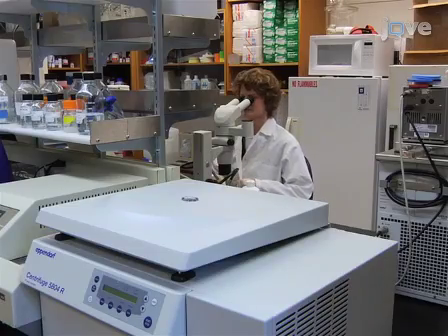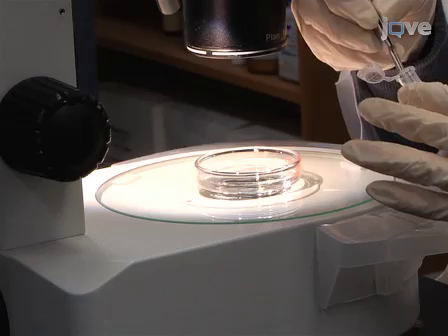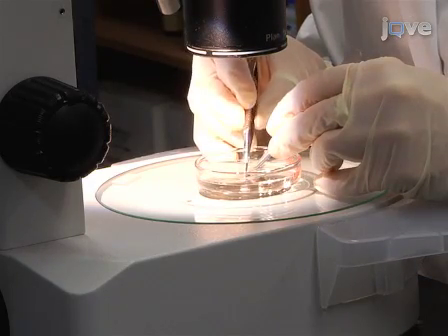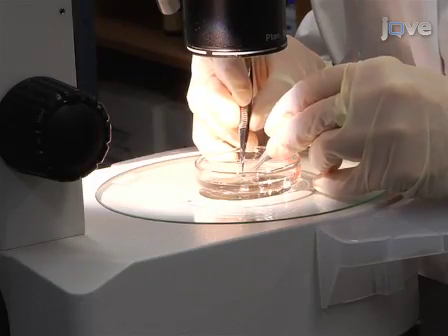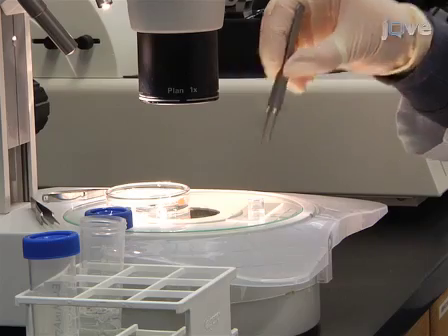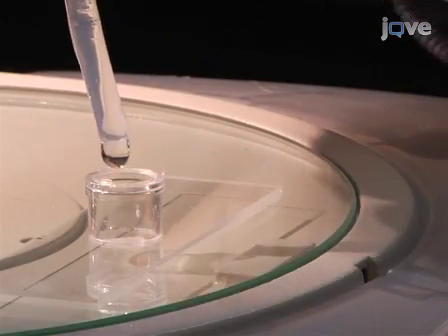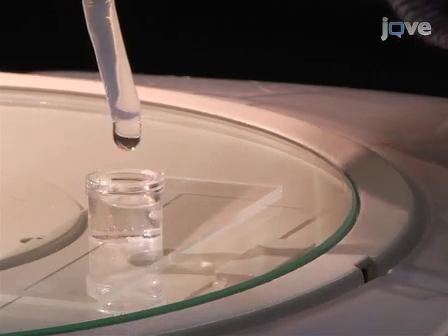On the day of the protocol, dissect a mouse lower urogenital tract that has been rehydrated with graded methanol PBS-tween washes. Discard approximately two thirds of the bladder and store the remaining lower urogenital tract tissue in PBS-tween. Now place a treated ring mold on a glass microscope slide and fill it with 4% low melt agarose solution at 62 degrees Celsius and allow it to cool for about 2 minutes.